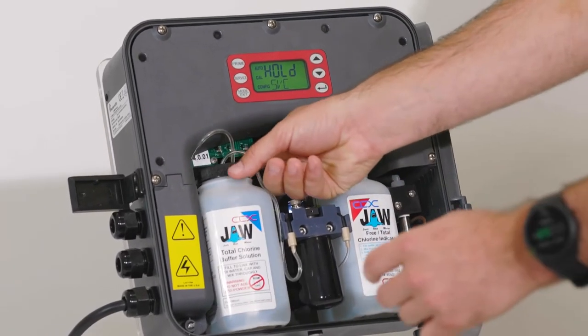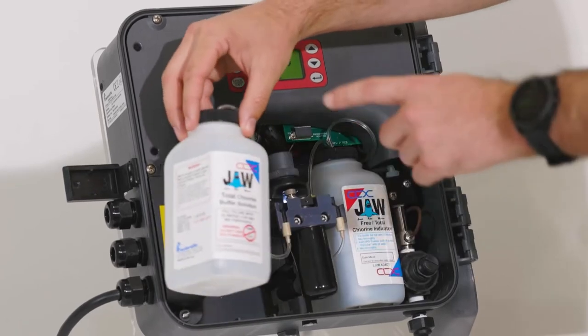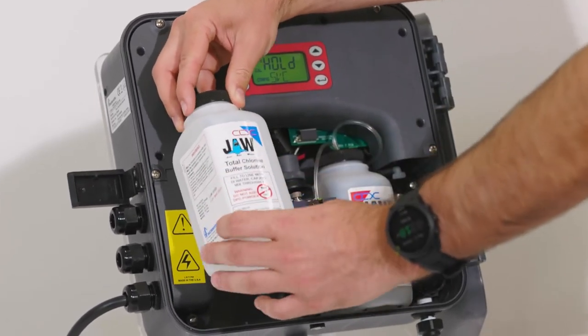Once it says hold we'll start by taking the old reagents out. We want to hold the cap and twist the bottle to take the reagent out.